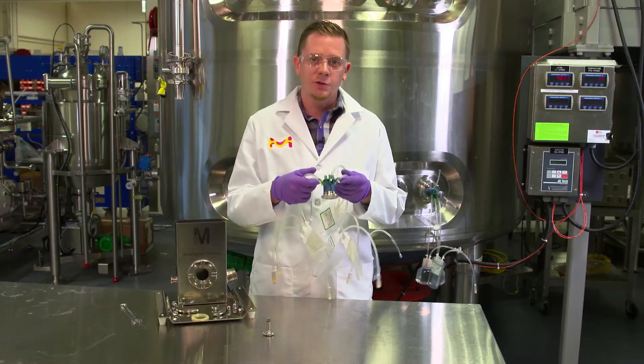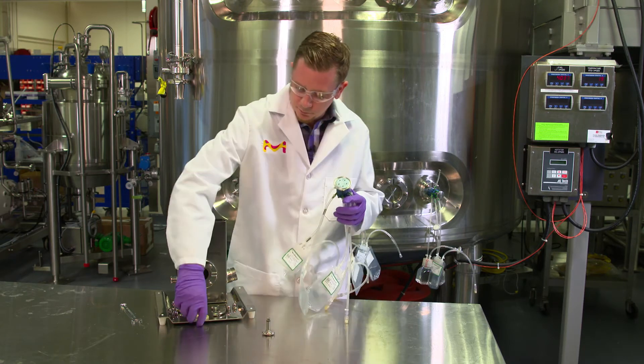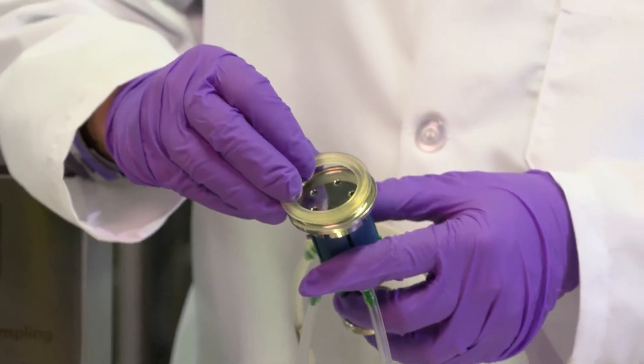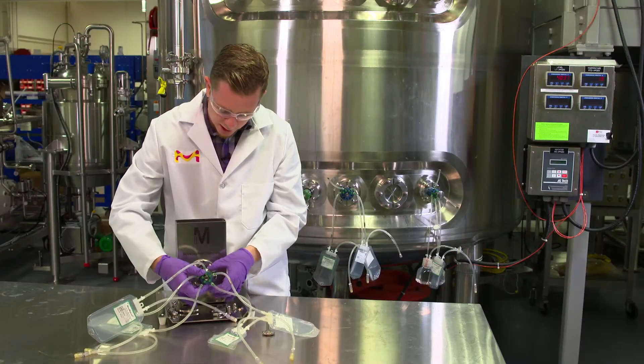At this point, we're ready to install this onto our tank. So we take our loaded holder, make sure we install a gasket, and push it onto our NA connect port.